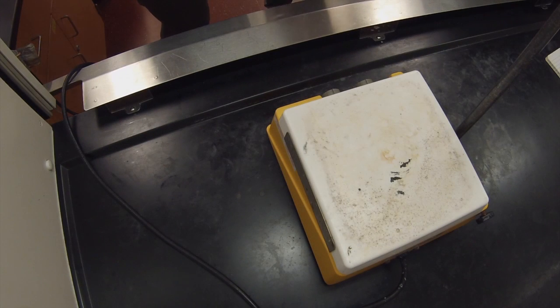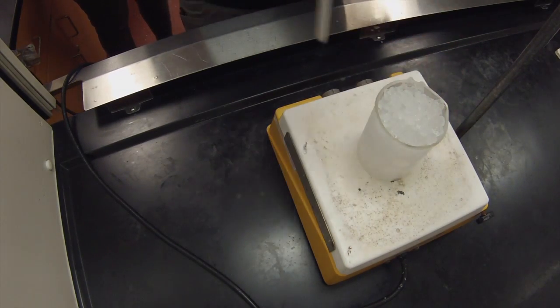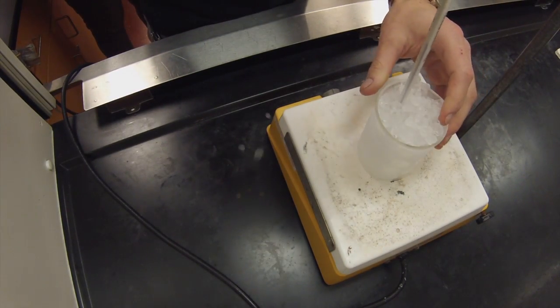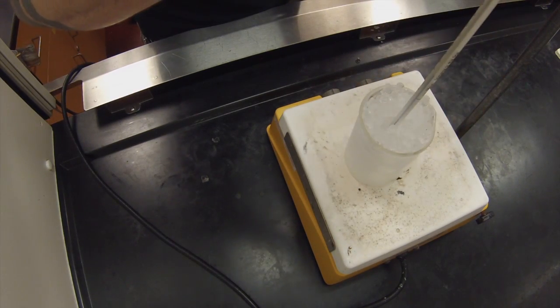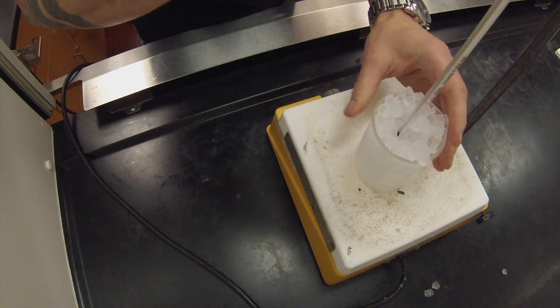Today we're going to take a look at the water lab and the procedure for this lab. We'll start off by getting a hot plate and a beaker full of ice and a magnetic stir bar. Set that on the plate and insert a thermometer, being careful not to let the bulb of the thermometer get too close to the bottom or sides of the beaker.